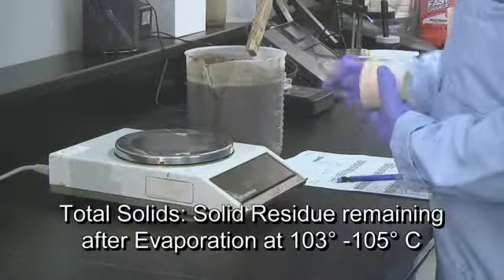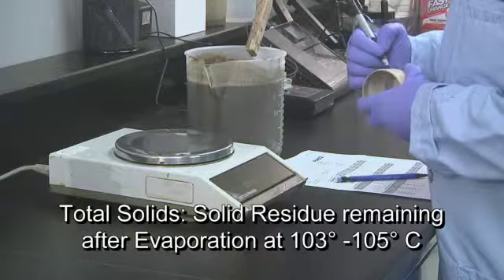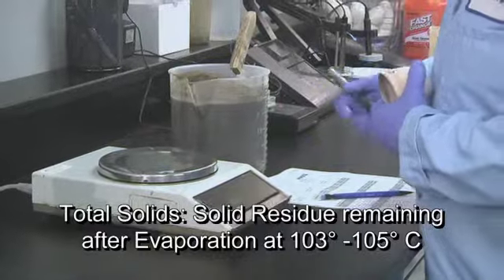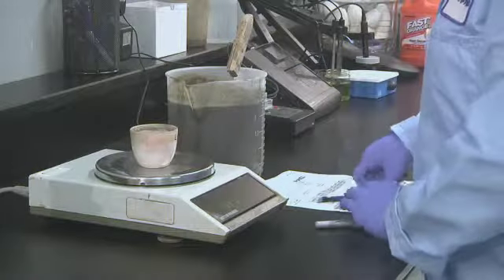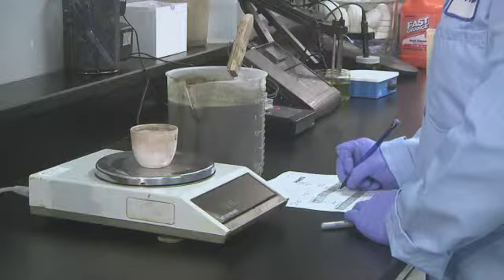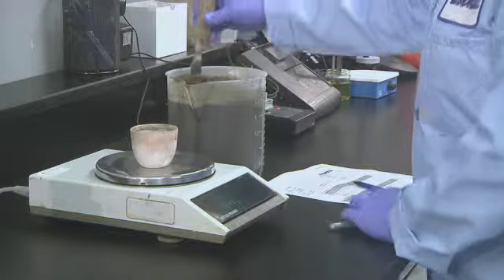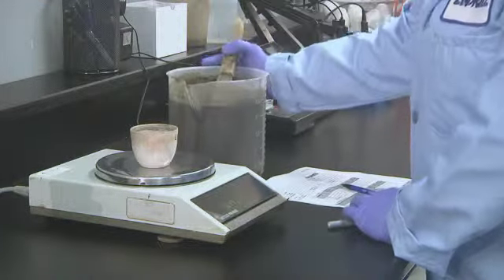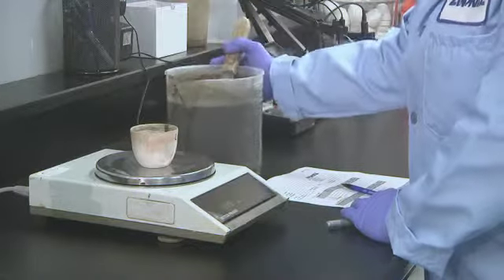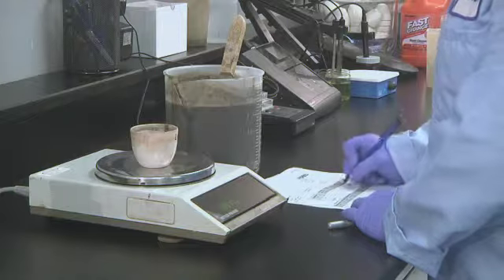To measure total solids, a well-mixed slurry sample is evaporated in a pre-weighed dish and dried to a constant weight in an oven at 103 to 105 degrees centigrade. The increase in weight over that of the empty dish represents the total dissolved and suspended solids present in the sample.